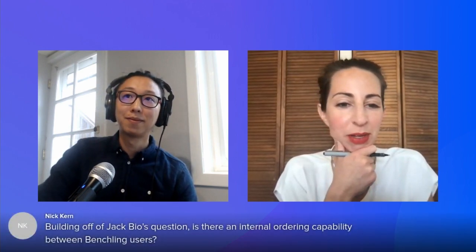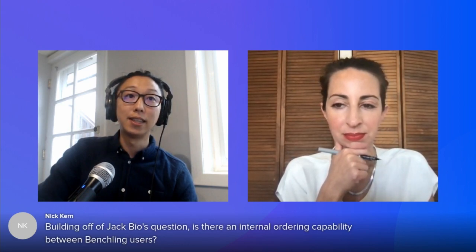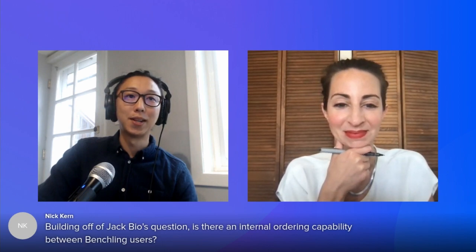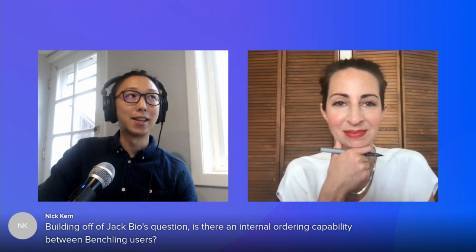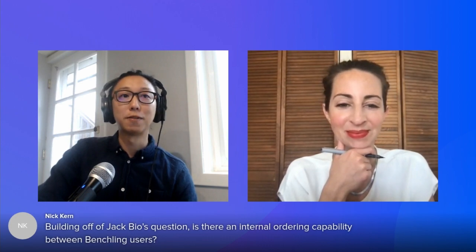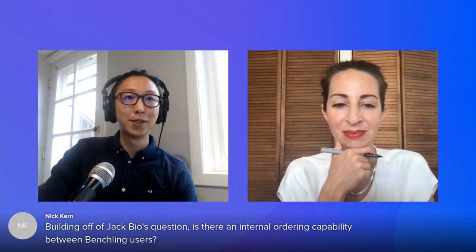Yeah. And then he was also following off of Jack's question. Is there any internal ordering capability between Benchling users? We don't currently have an integration with different synthesis vendors to initiate orders, but that is actually a hot topic for us, and a project that we're really looking to invest in over the next few quarters. So definitely stay tuned. I think there's quite a lot of interest and demand, not just from folks attending this webinar, but across all of our customers for a better integrated solution with all of the most common synthesis vendors.